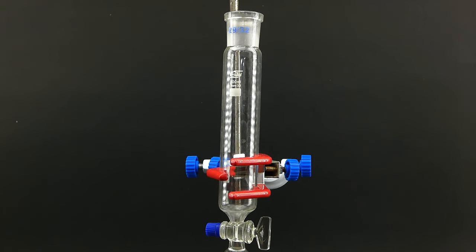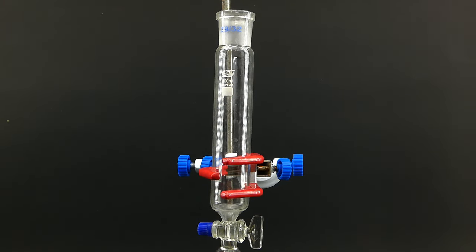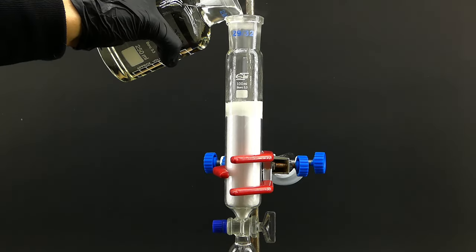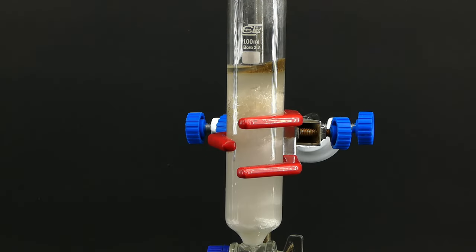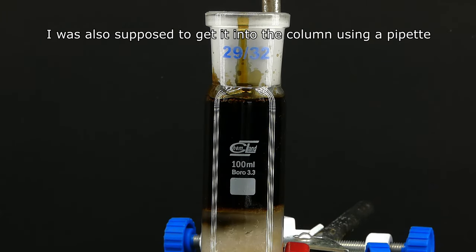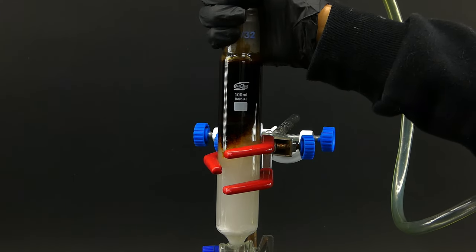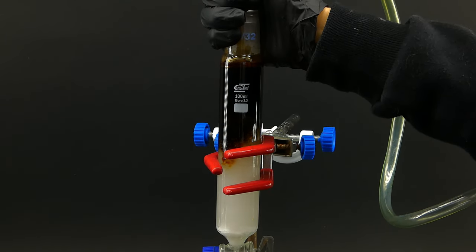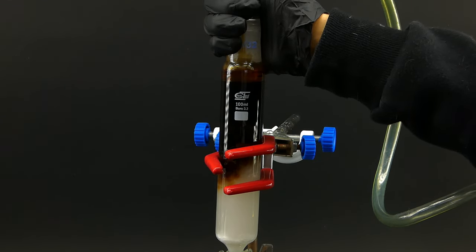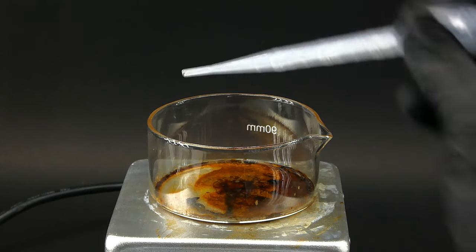Now with everything ready, I set up the column. I didn't have glassware specifically designed for this, so I used an addition funnel — which in hindsight was way too narrow. I put some cotton on the bottom to keep the silica gel in place and filled it about two-thirds of the way with the ground gel, wetted it with some eluent, and dropped some acid-washed sand on top. I dissolved all of the cubane tar in the eluent and loaded it into the column. The layer was unfortunately way too thick, but I just don't have better glassware. I applied some air pressure to make the cubane come through — the idea being that it would be separated from the black impurities by the silica gel. It should in theory come through first as a nice light brown color, but here it was nearly black, and it also didn't dissolve in methanol, which was really weird and made me a little worried.